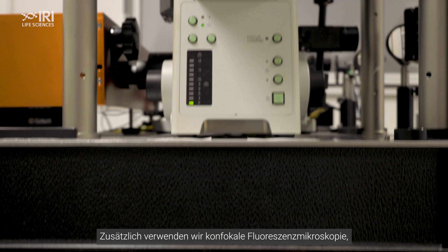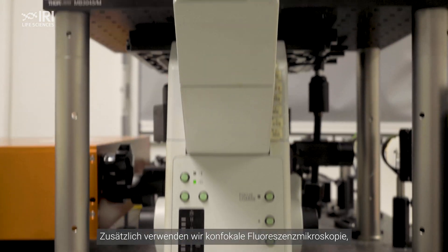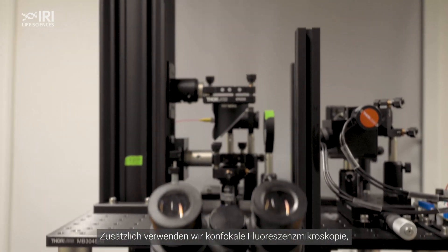We also use confocal fluorescence microscopy, which can with very high specificity tell us the location of fluorescently labelled molecules in three dimensions.